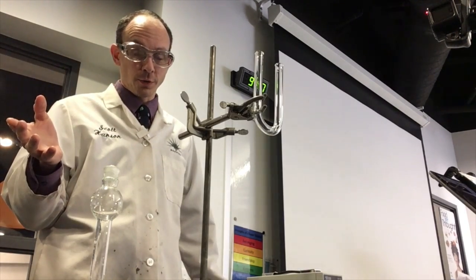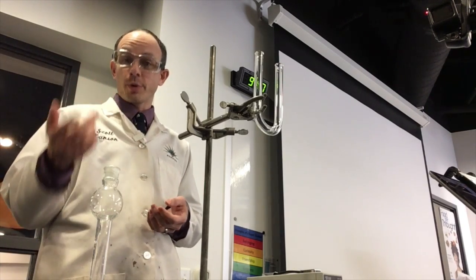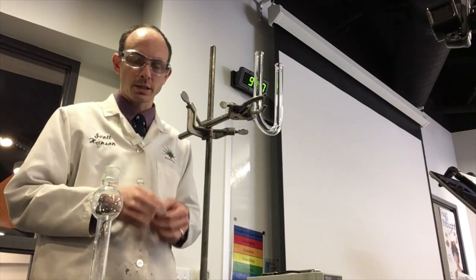Hey guys, I got a special video for you today. We're going to explore a little bit of electrochemistry and we're going to match it to that worksheet that you were working on last class.